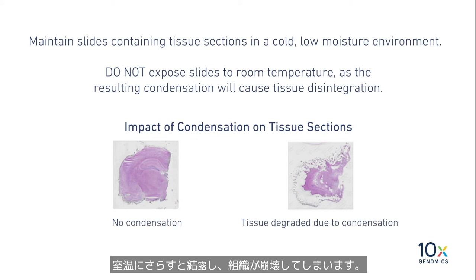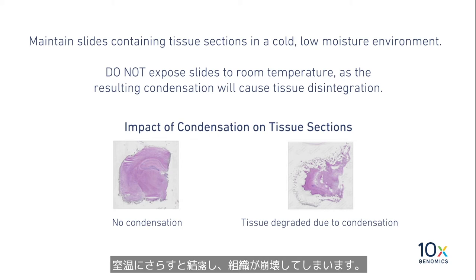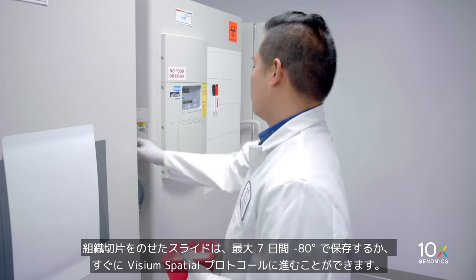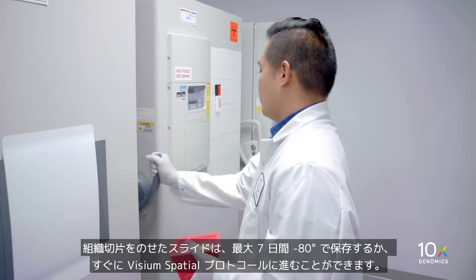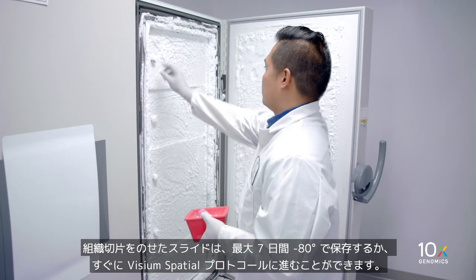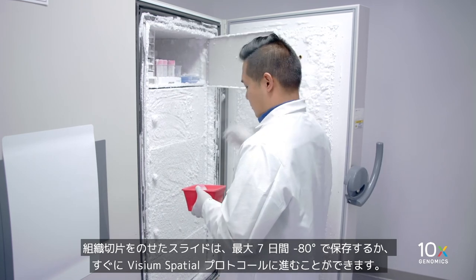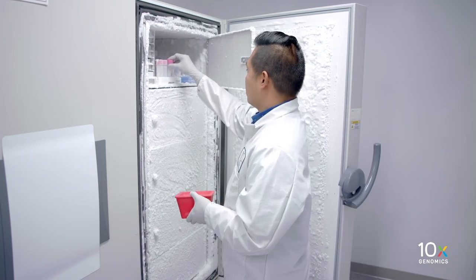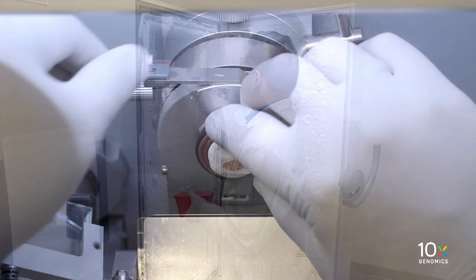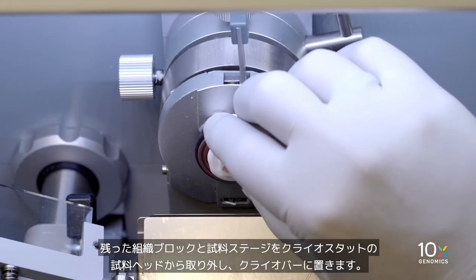Maintain slides containing tissue sections in a cold, low-moisture environment. Do not expose slides to room temperature, as the resulting condensation would cause tissue disintegration. Slides containing sections can be stored at minus 80 degrees Celsius for up to seven days, or immediately proceed to the Visium Spatial protocols.